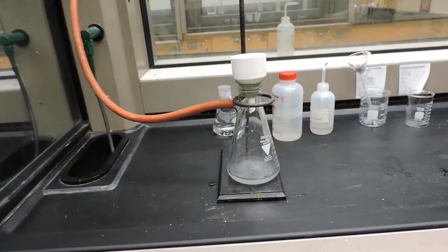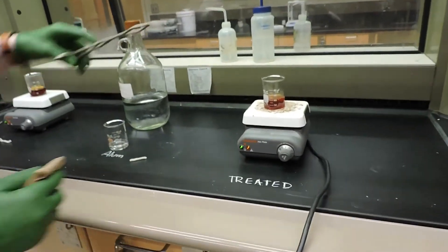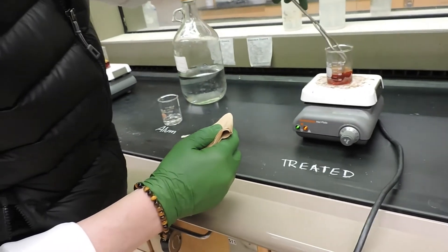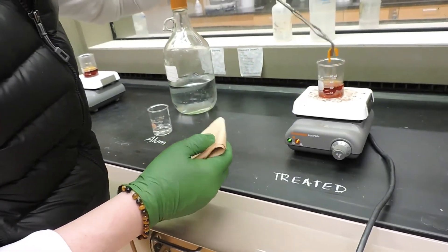So while we wait for our crystals to further dry, we're going to pull the wool out of the treated baths, rinse them with water, and dry them on a paper towel.